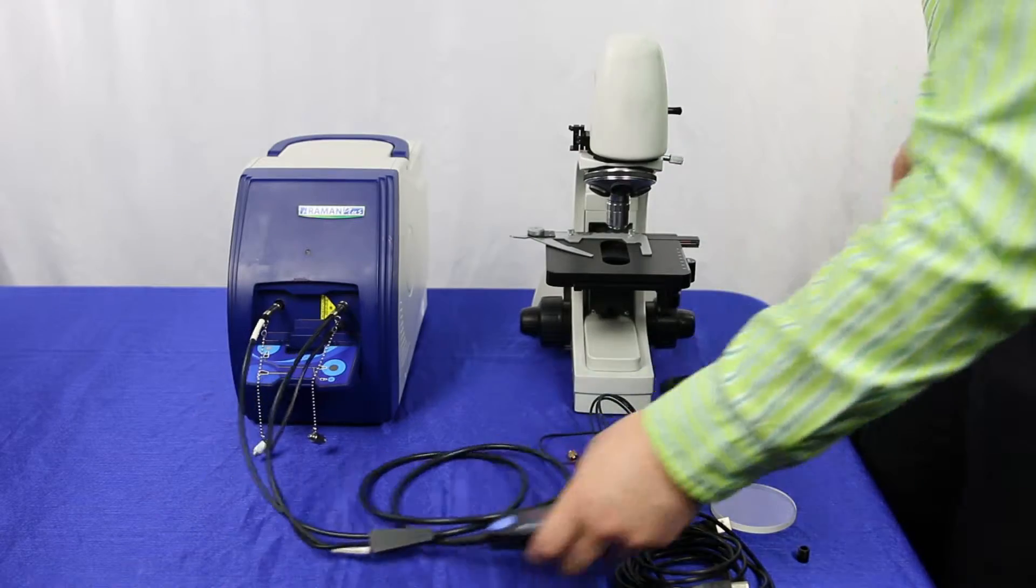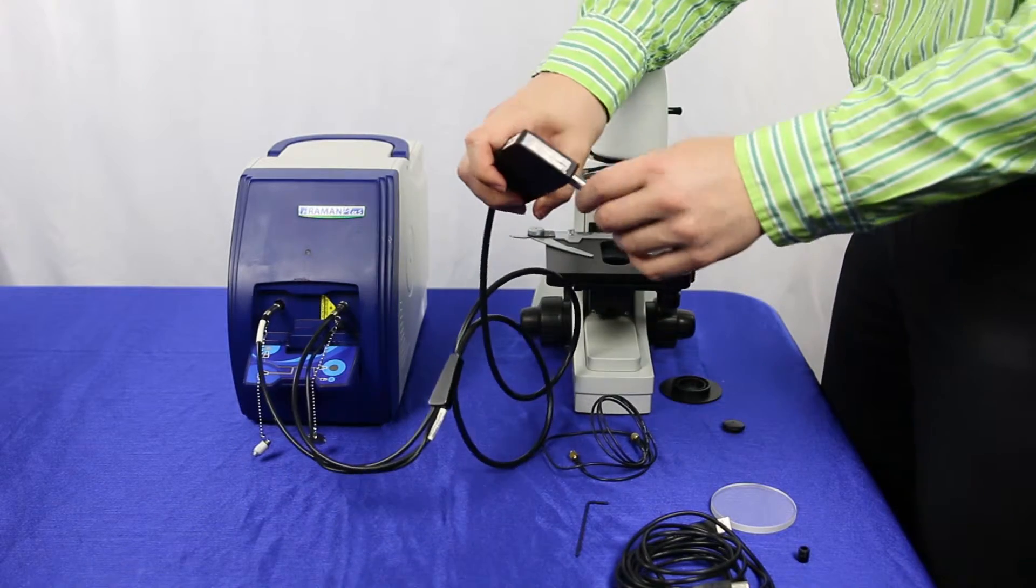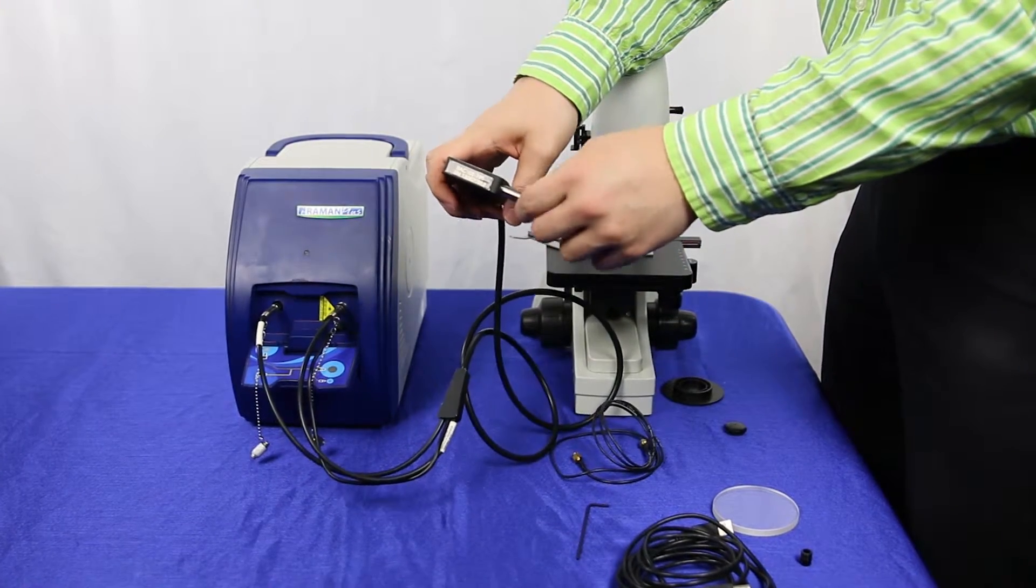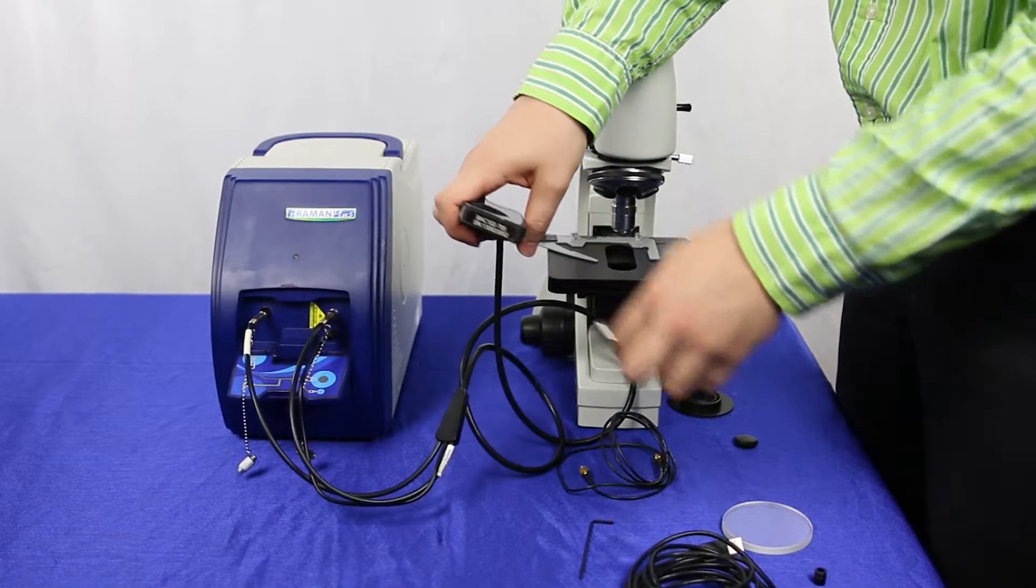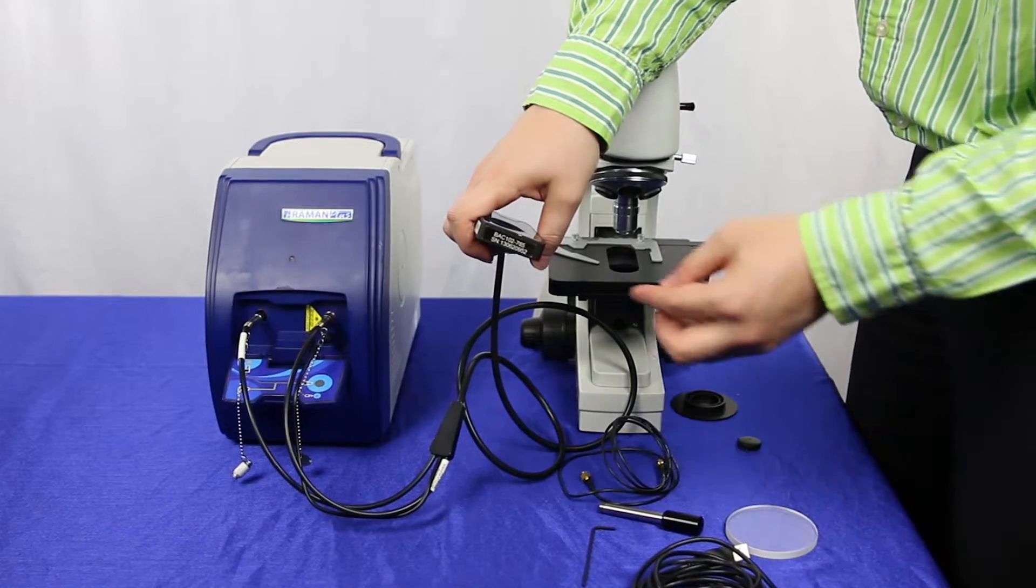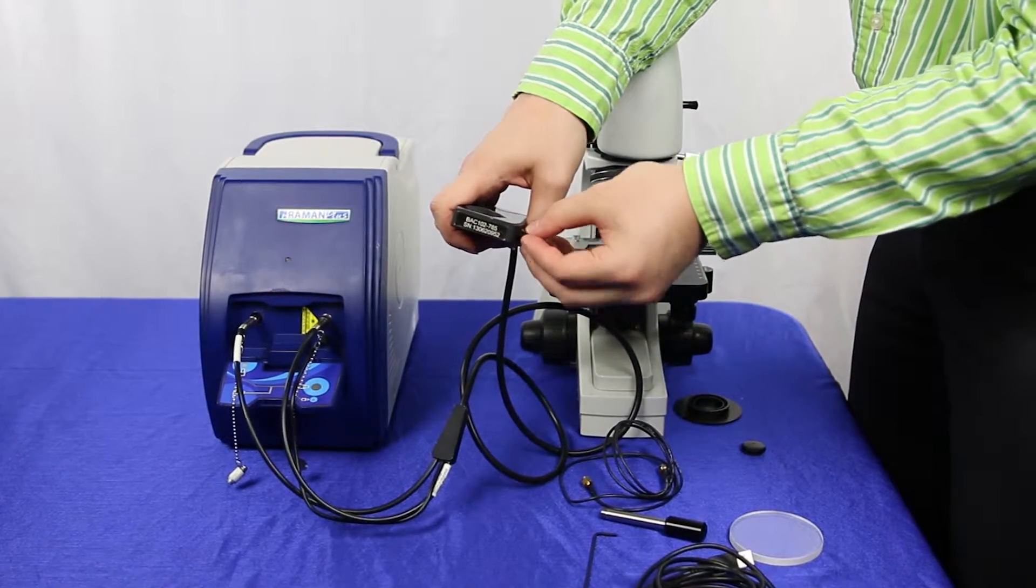The next step is connecting your probe to the microscope. You want to start out by removing the current probe head and exchanging it with this microscope adapter.